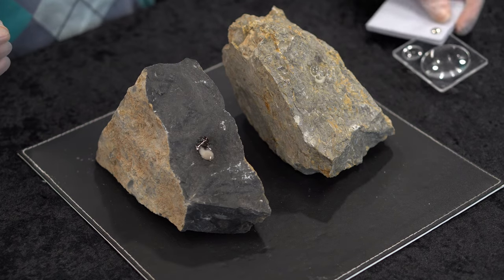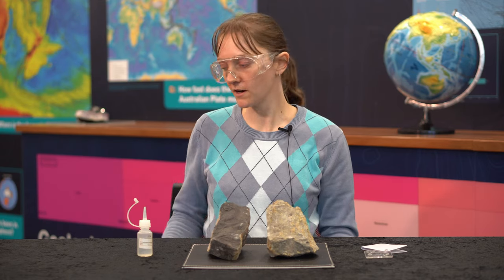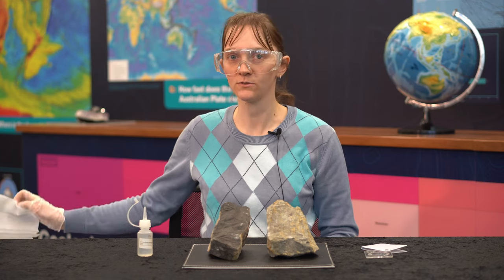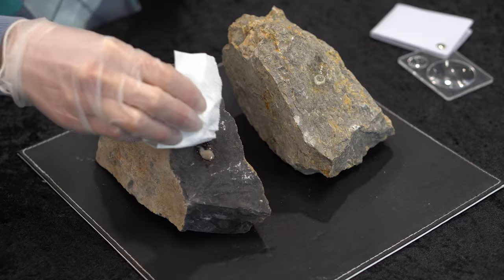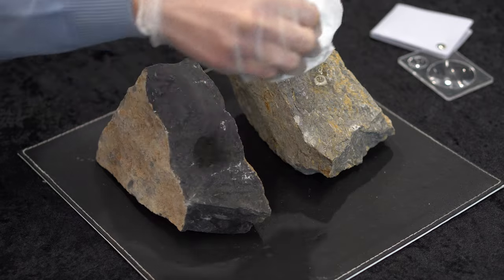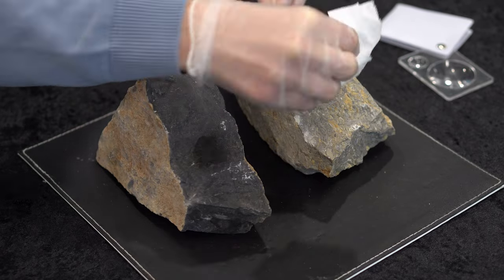Note your observations. Once you've finished with the experiment, make sure — still wearing your gloves — use a piece of paper towel to wipe dry the hydrochloric acid.